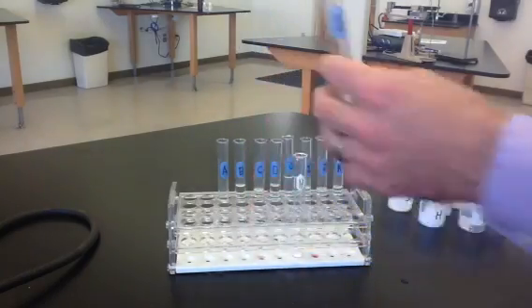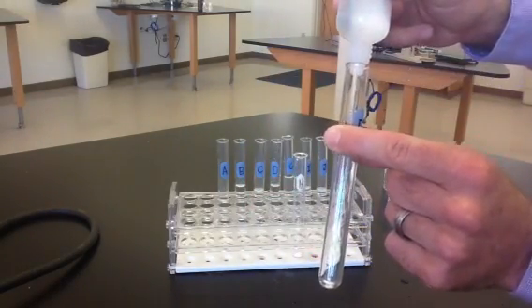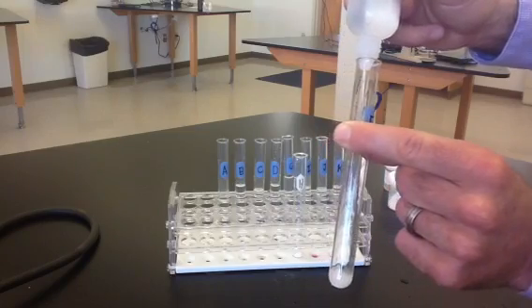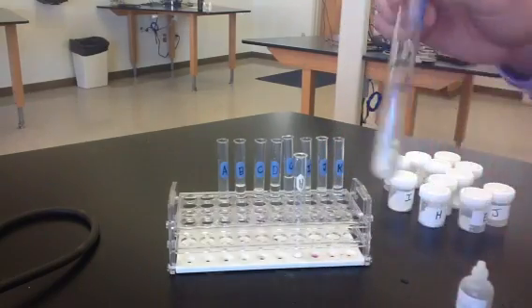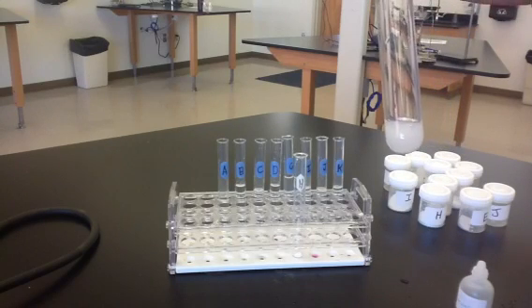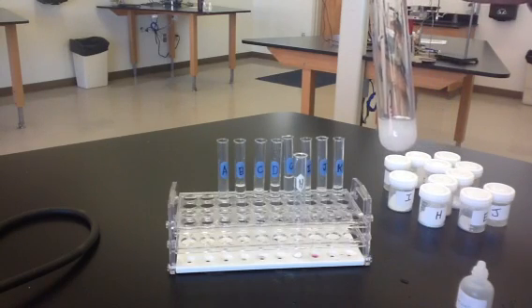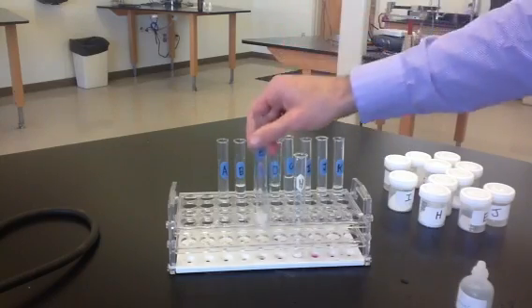So we'll do it first to E. So we'll add some vinegar to substance E. And we should see what occurs here, and you can see no reaction when E is added to the vinegar.